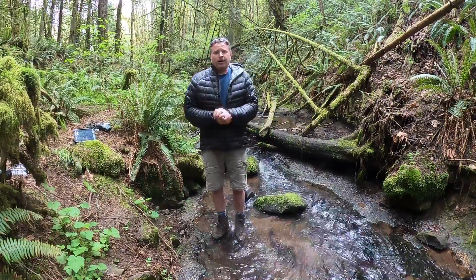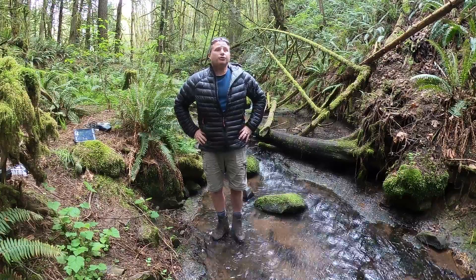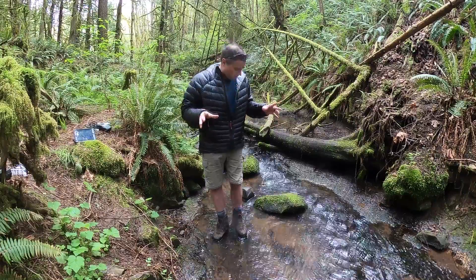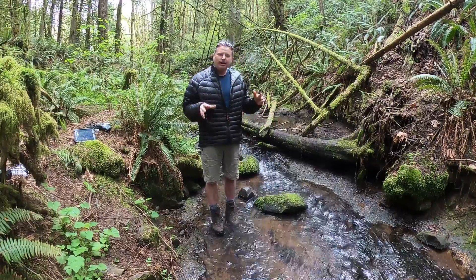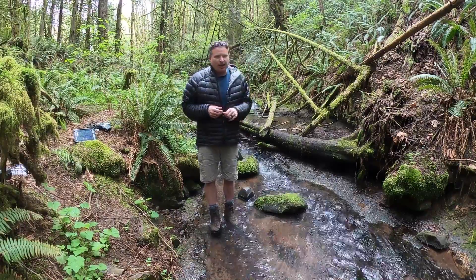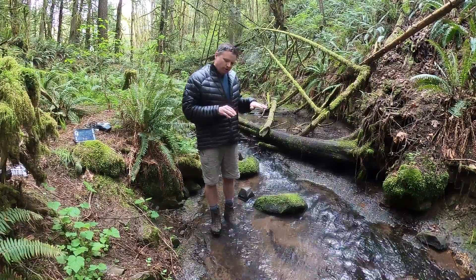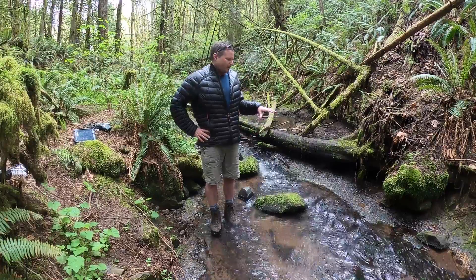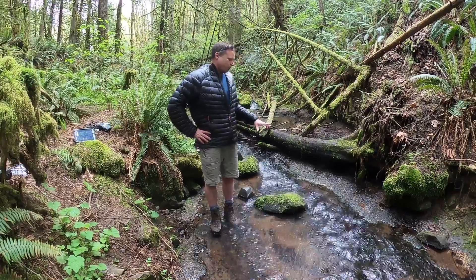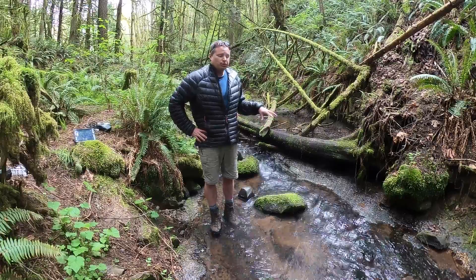Welcome to the Hopkins Demonstration Forest. It's a beautiful Tuesday afternoon, and I'm standing right now in the middle, or at the edge, of Little Buckner Creek. It's the creek that runs along the border of our property at about average flow for this time of year. It's a pretty small creek, and we're going to measure a few water quality factors that come into effect when we're talking about salmonoids and some of the fish that might be in the stream.